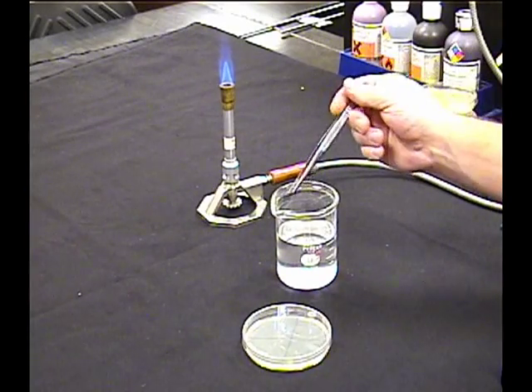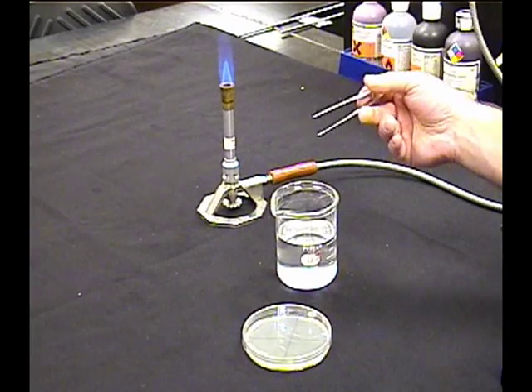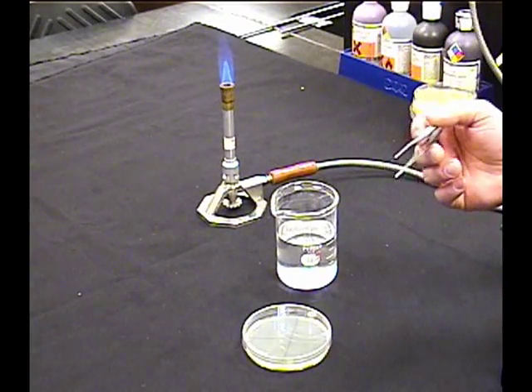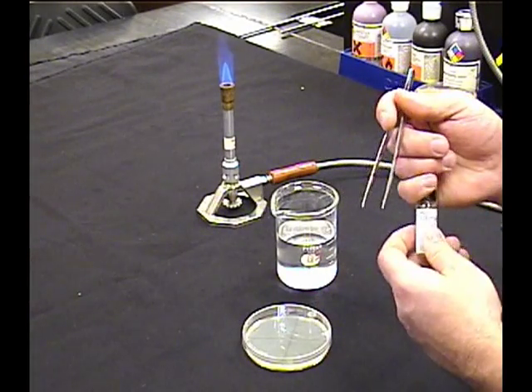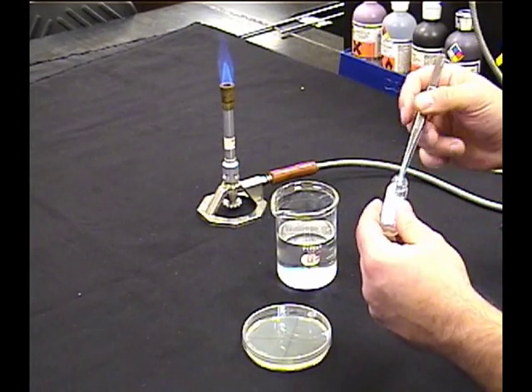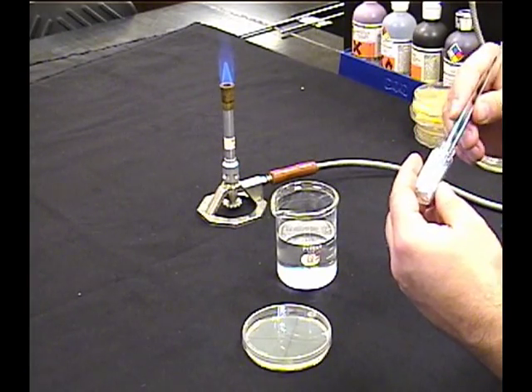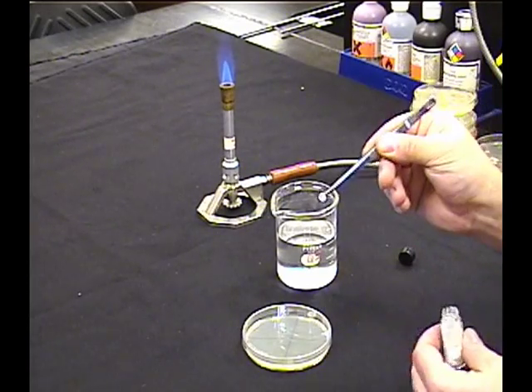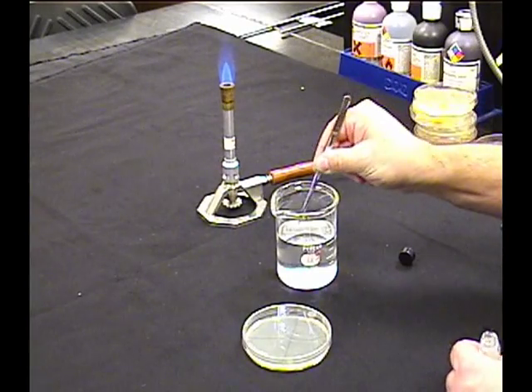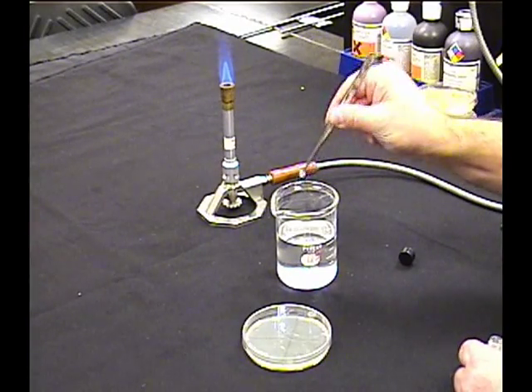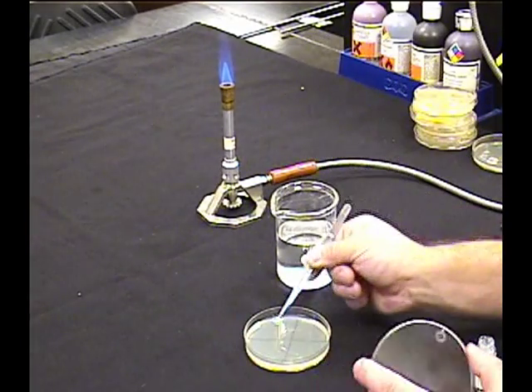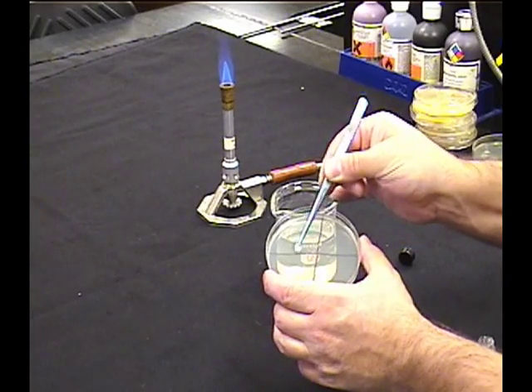So what we've done is we've taken our forceps. We have managed to sterilize them. We've managed to ignite them and get the ethanol off. Now, we take the lid off. I drop the cap. You reach in. You take out a filter paper disc. You dip the filter paper disc in something. In this case, I'm going to dip it in ethanol. And then shake it just a little bit to get rid of the extra stuff and set it in a quadrant gently.